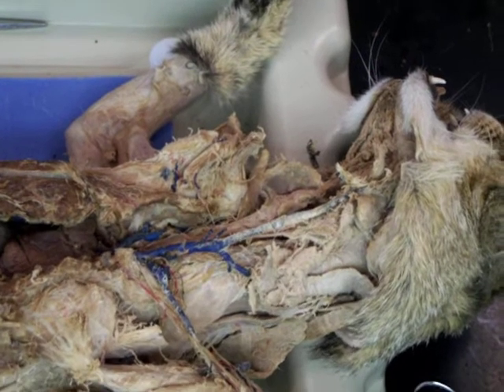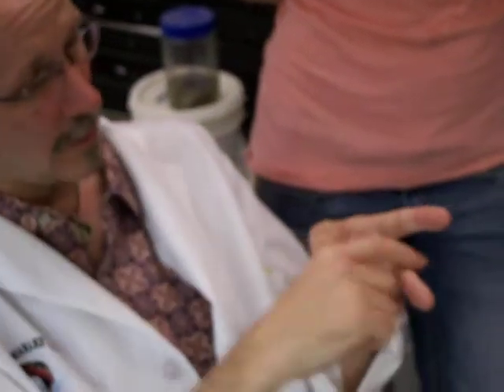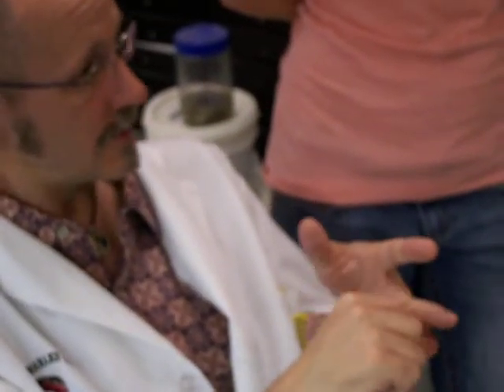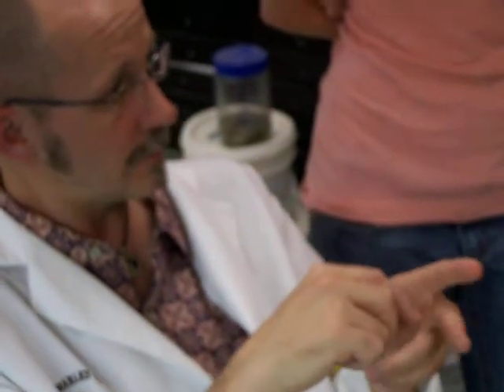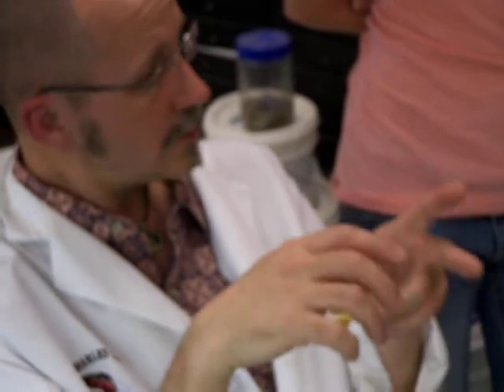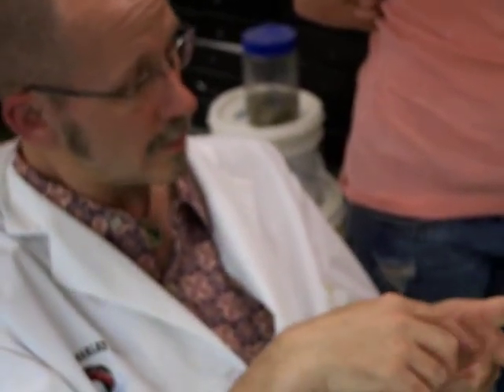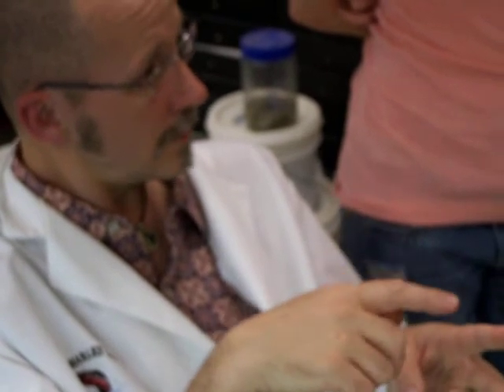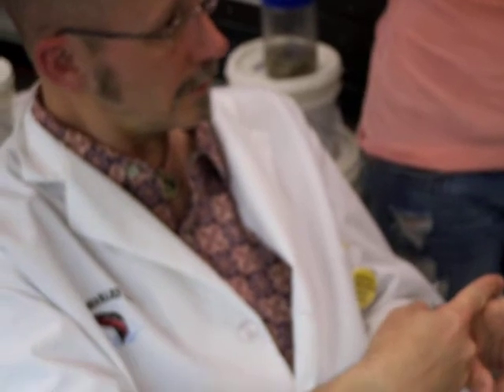Okay. Now the common carotid is going to split up into the internal and external carotids. Now in the cat, unfortunately, the internal carotid is vestigial, and usually it'll just be a little tiny piece of connective tissue that's lost in all the other fascia in there. So you can't really see where the internal carotid is, but you can see where these other arteries are located. The thyroid is going to go medially toward the larynx.